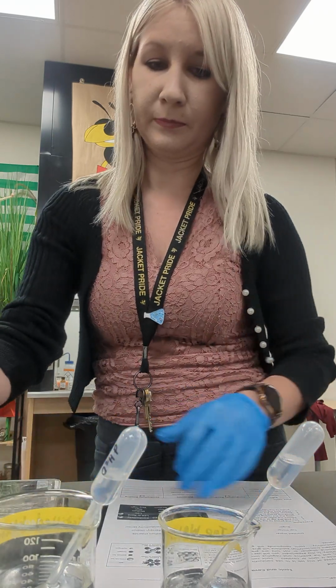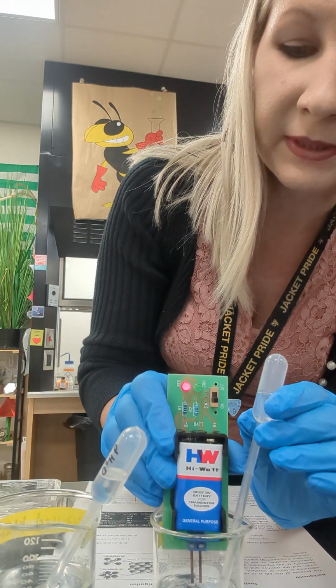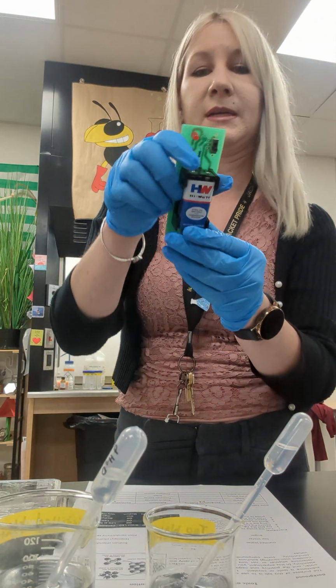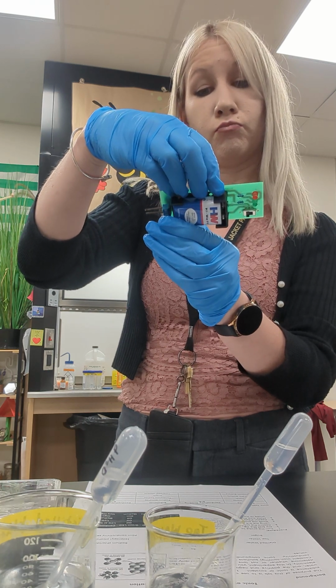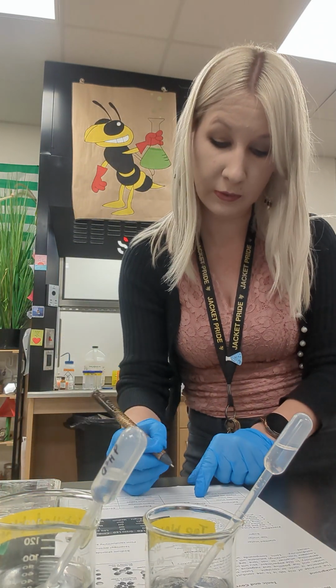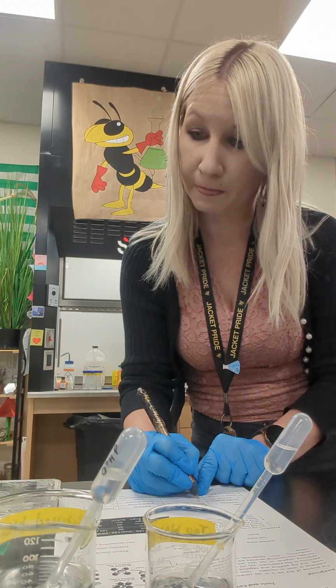And I'm going to use my rinse, which is also distilled water. Whereas tap water, we see that bright red light come on because the tap water does have some dissolved minerals in it, some contaminants. So a medium red light with the green light off, that's a medium signal, or scale of 2. So distilled water, we have a conductivity reading of 0. Tap water, we have a 2.